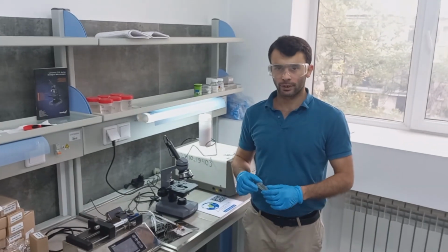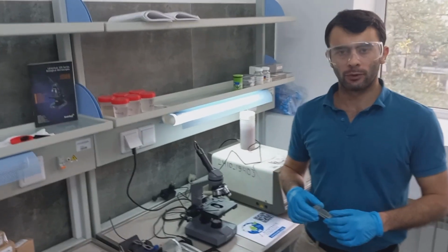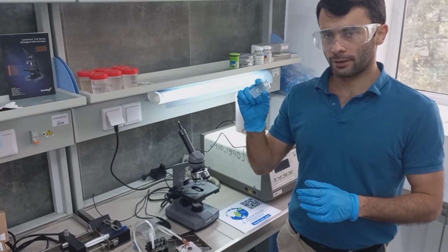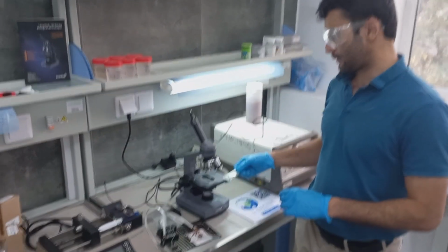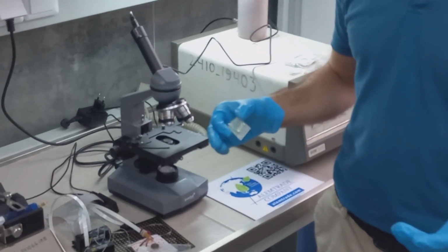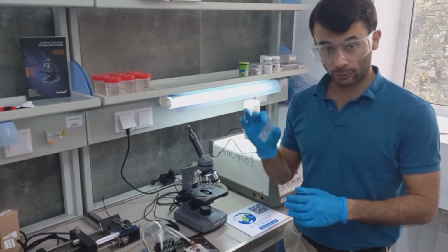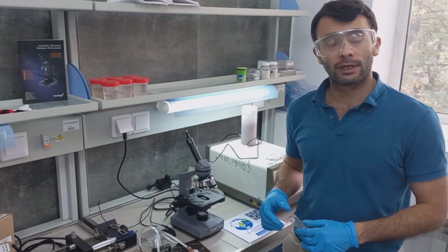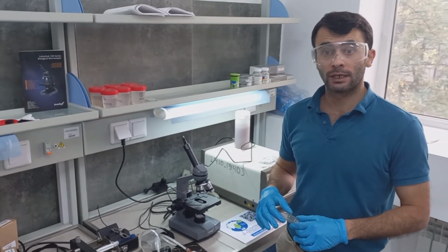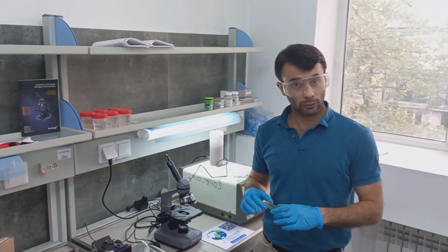In this laboratory, we use such models in order to visualize the process of oil displacement on micro level. This model has a lot of microchannels inside, and it is placed under the microscope, and then different fluids, including oil, water, and solutions of different chemicals, are injected inside of this model. This helps us to visualize different processes which take place on the micro level and helps us to visualize interactions of different fluids inside of a porous media.